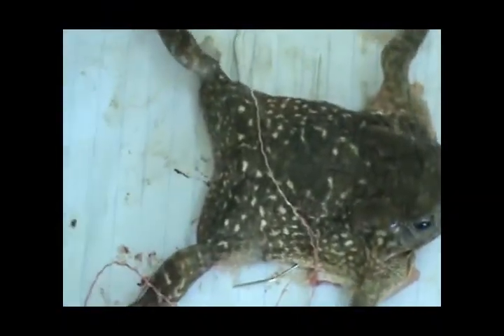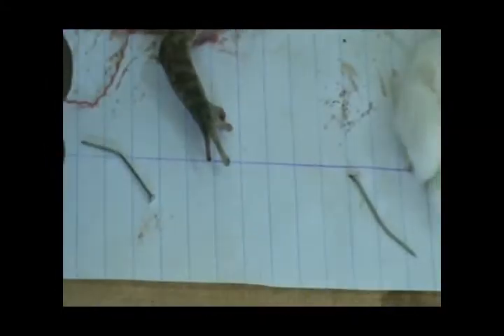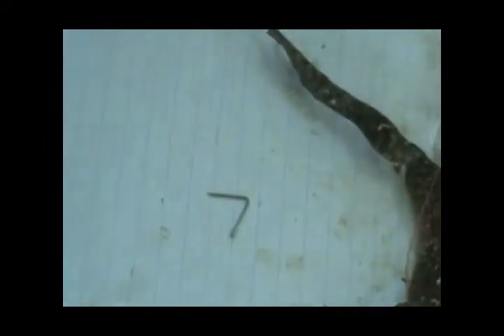It also has webbed feet, only on the hind limbs — the forelimbs are not webbed. The webbed feet are for swimming, since it mainly lives in water.